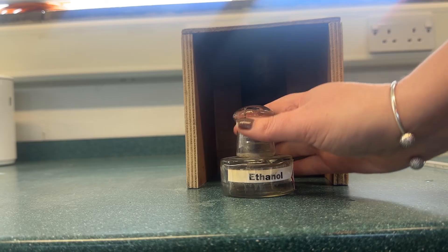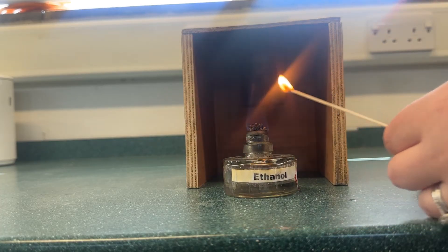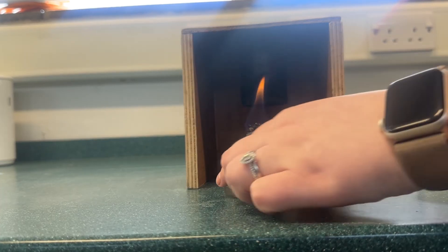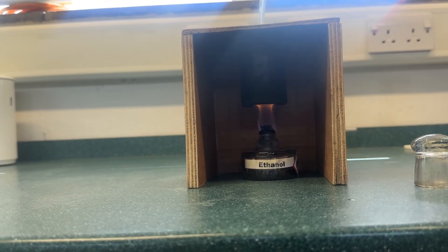You should then stir the water using the thermometer. Be careful that the thermometer does not sit on the bottom of the beaker, as you will get an inaccurate temperature reading.